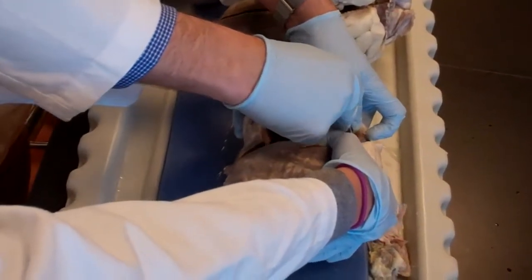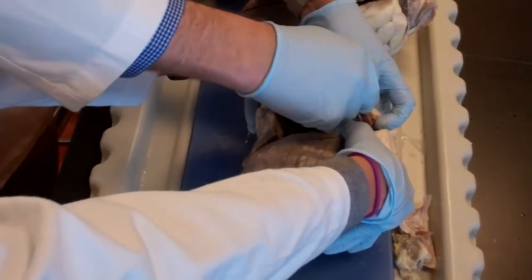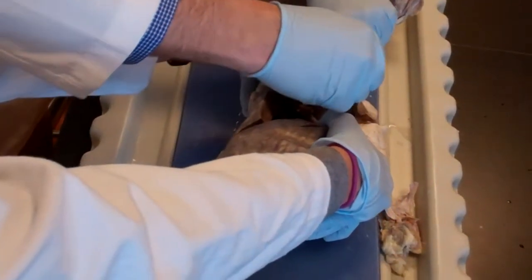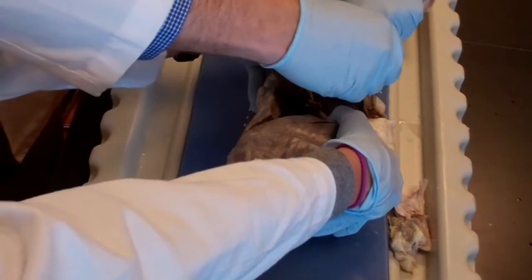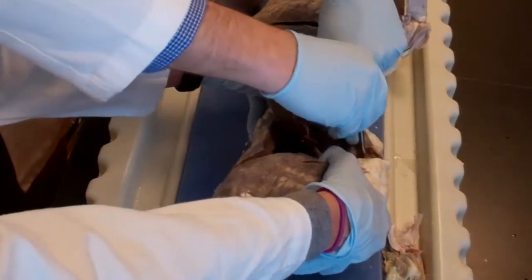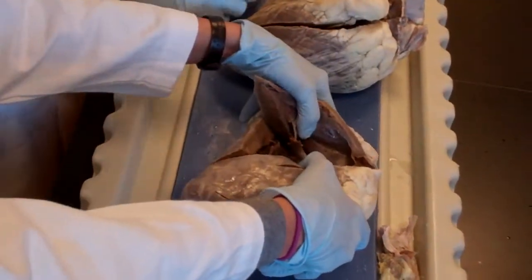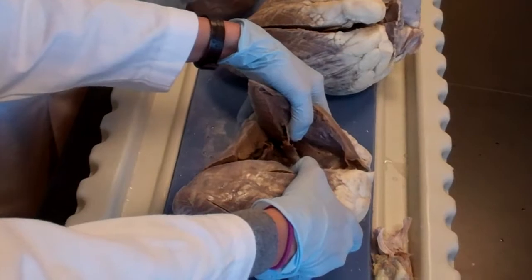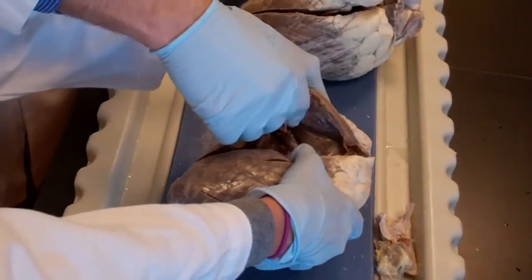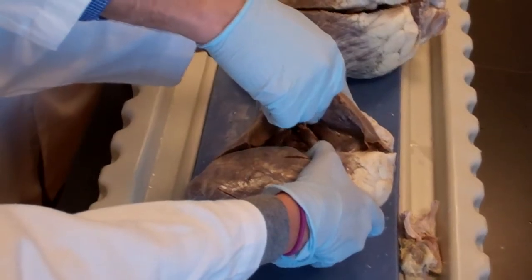And this is the one that was cut into 2 when we made the cut here, okay? So 1, 2, 3, there's one hiding. You can put your whole finger in that valve leaflet, okay? And what's the difference between this and this? No chordae tendineae. Alrighty? Yes?